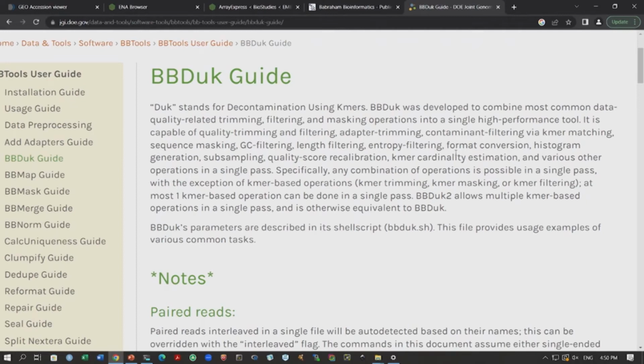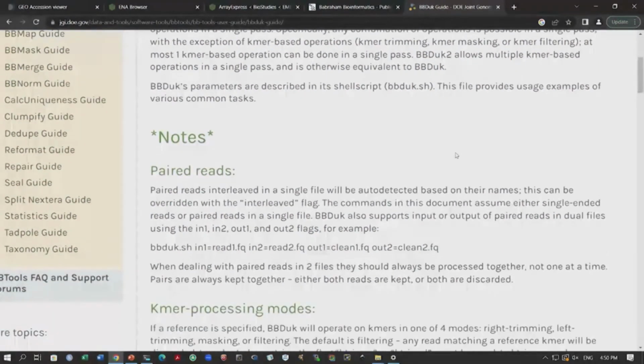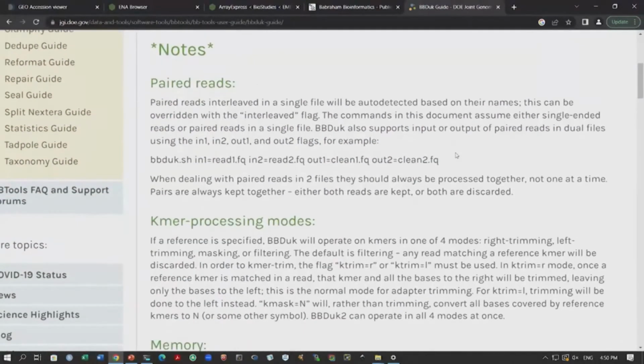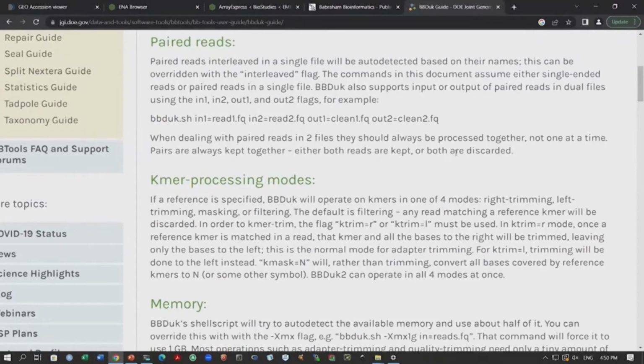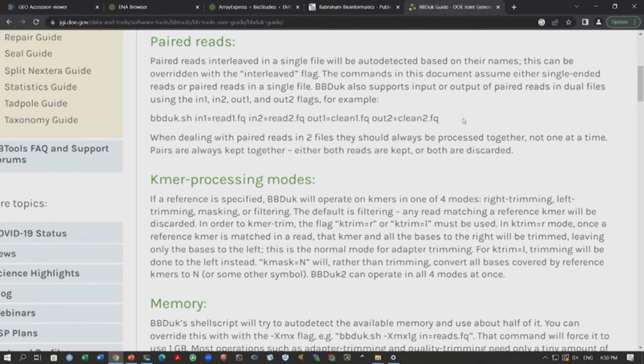We will not go into that. There is a lot of details. If you are interested, you can always read. You have all the instructions, also how you should run this tool with your read data. For example, this is what we are going to use: bbduk.sh in1=read1.fq and then in2=read2.fq, out1, the output file names.